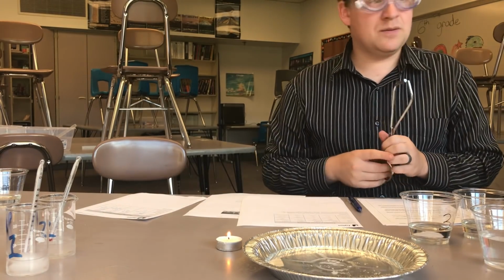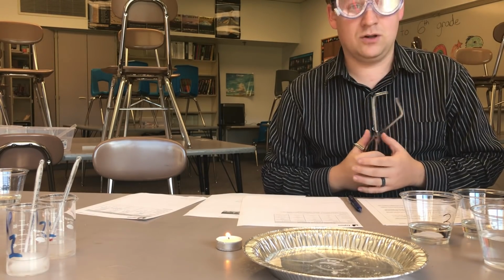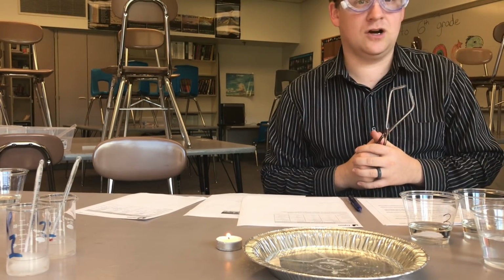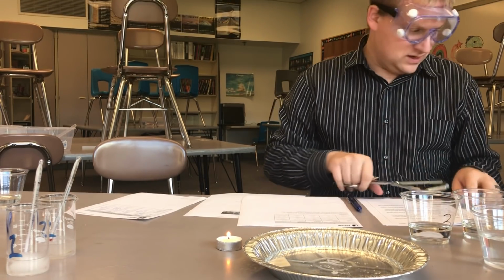Yes. So the flammability test is the last test we're going to do, and then hopefully we'll have enough information about these physical and chemical properties of these liquids to hopefully identify them. We'll have a chart where we can compare it to some of the known properties of other liquids, and then hopefully we can identify it.